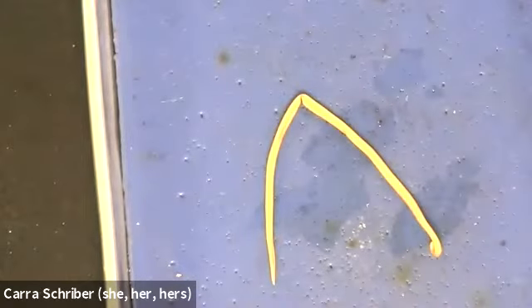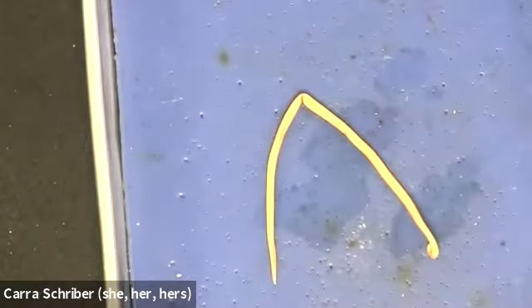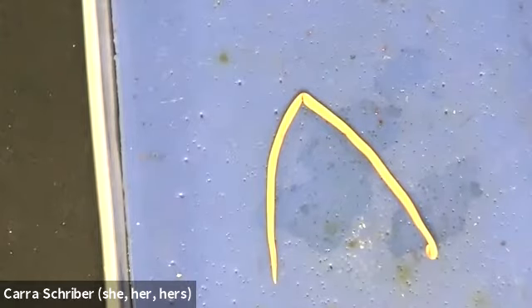It's kind of just a white sac, a long white tube, and roundworms are generally parasitic, so they're pretty simple. There's not really much to write home on this specimen, but obviously it looks quite different than the segmented worms that we were looking at. And what I really want you to see is how much different it looks on the inside. So I'm going to do a cross section here of the roundworm.